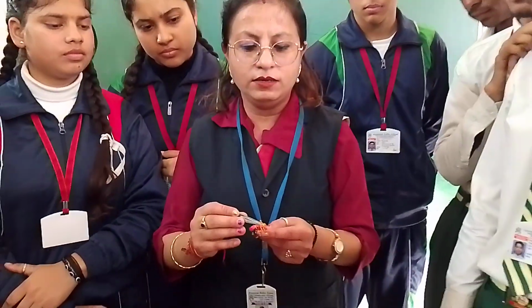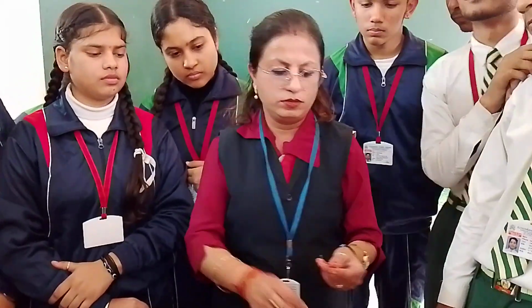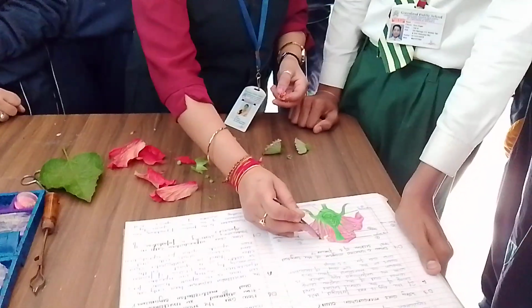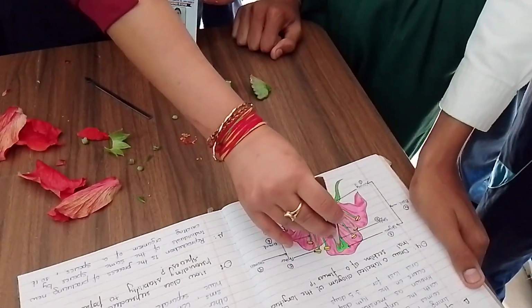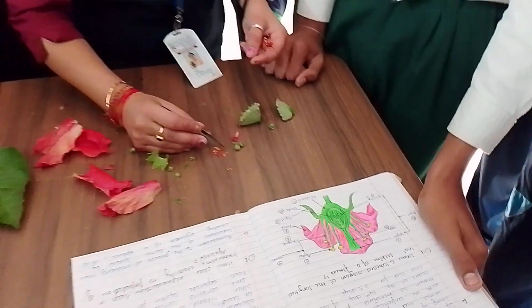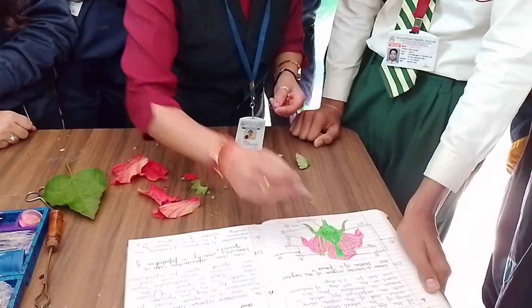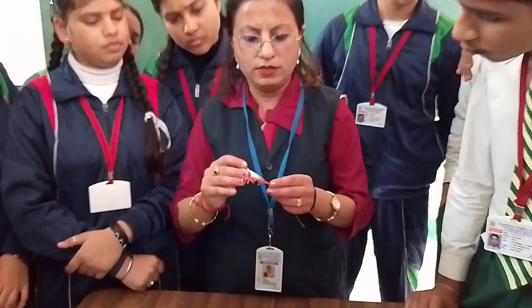During dispersal by wind, animals and water, in pollination, these pollen grains are dispersed and enter this stigma. It receives all these pollen grains, this yellow part. It falls over there and then enters this tube. This is called the style, which allows it to enter the ovary. The sac is like this. We will see.